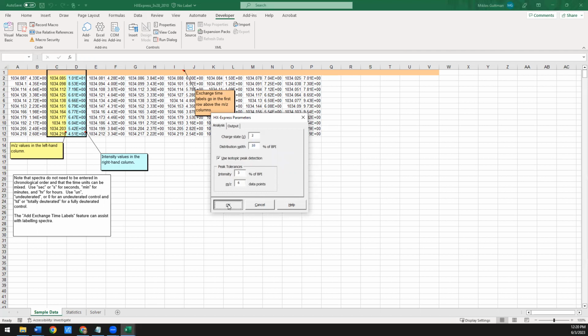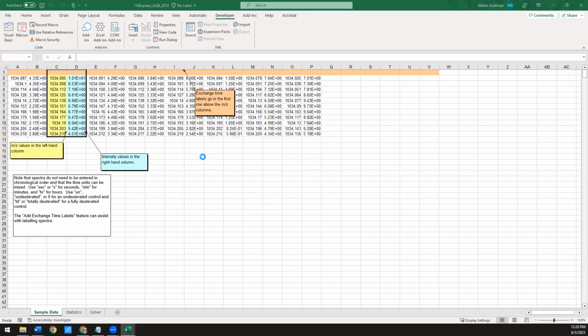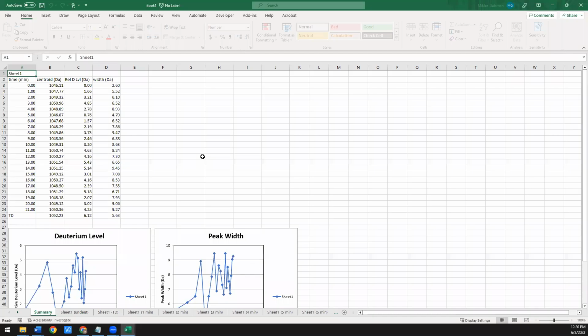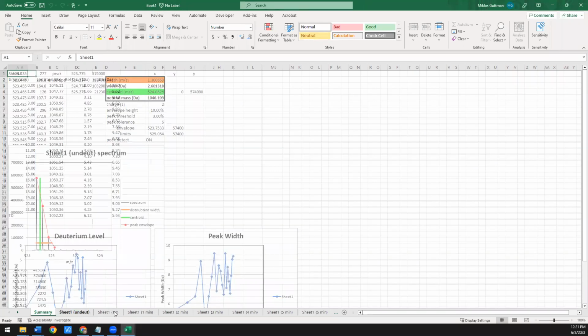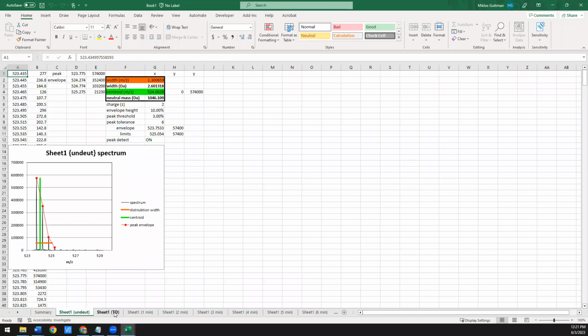So then if you say OK, it'll do the first process where it'll take all the data from that workbook and process it. It'll do all the peak picking and do a very simple centroid measurement. And it pops up this new workbook that it made. It just called it Workbook 1 or Book 1. And this one has a bunch of worksheets. Each worksheet is one of the different time points that was in the pair of columns in our data that we imported. So this is the undeuterated spectrum.